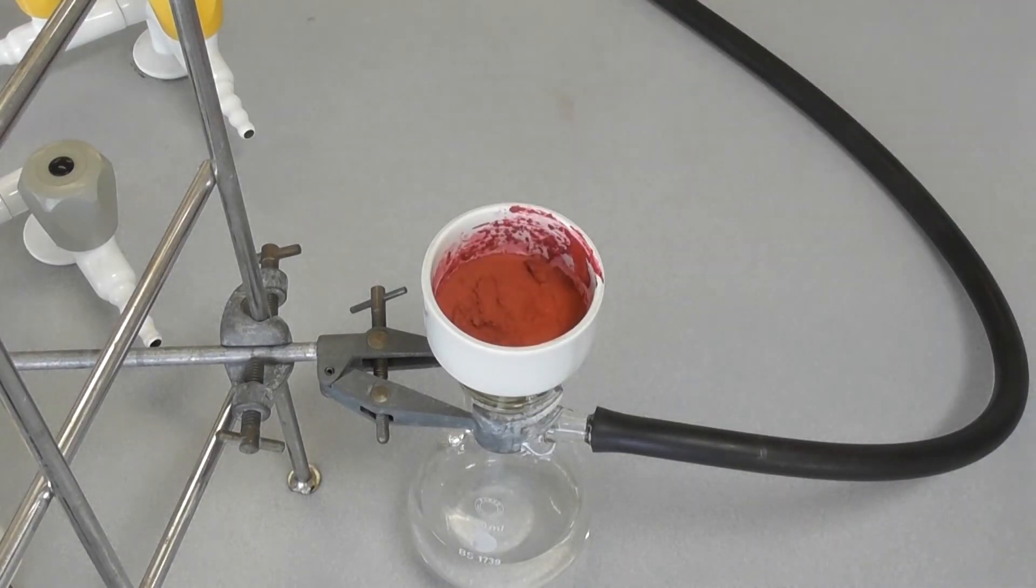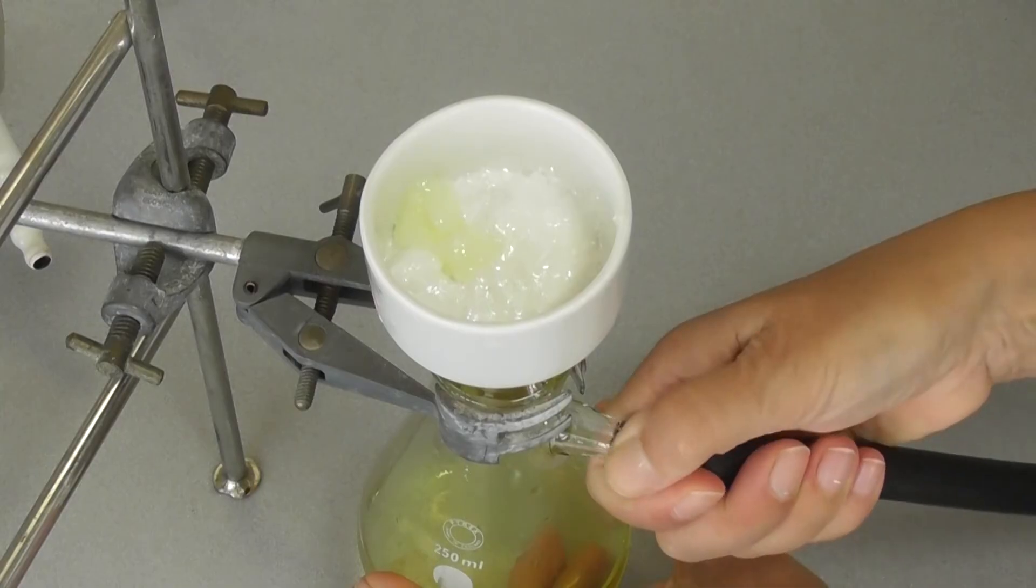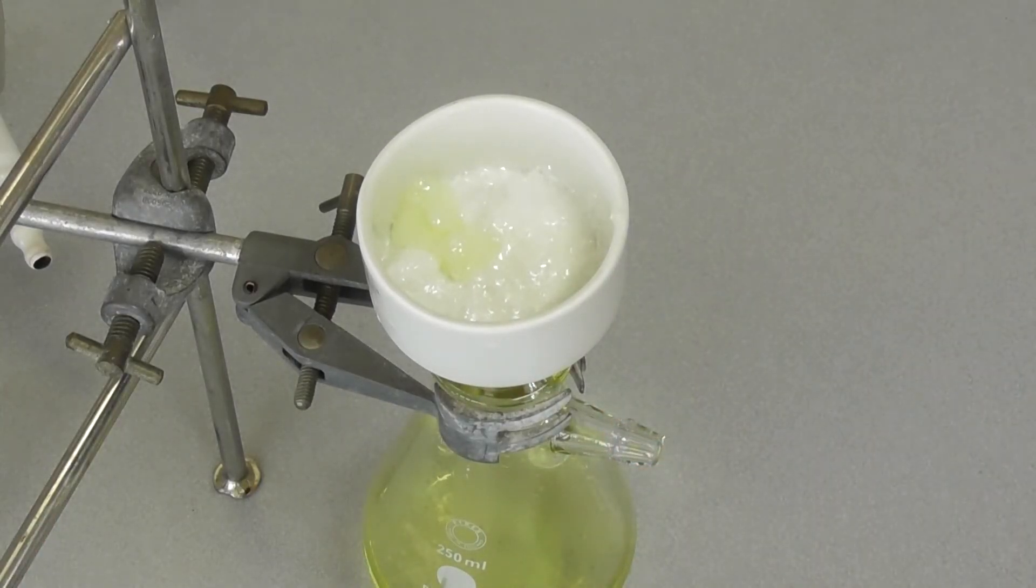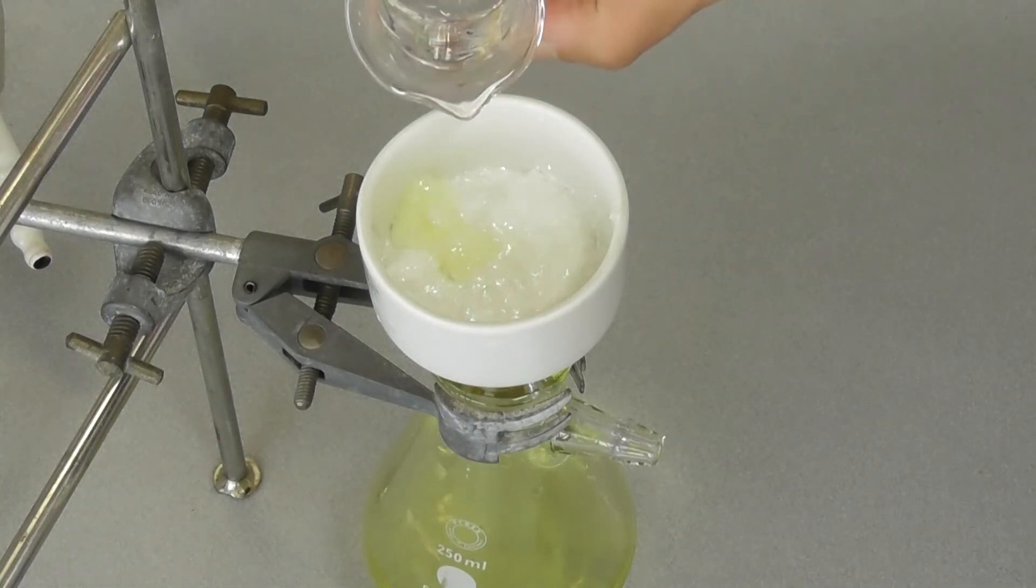Generally the effect of washing is not obvious. But in this example the impurities are a different color to the product, so the effect of washing can be clearly seen.